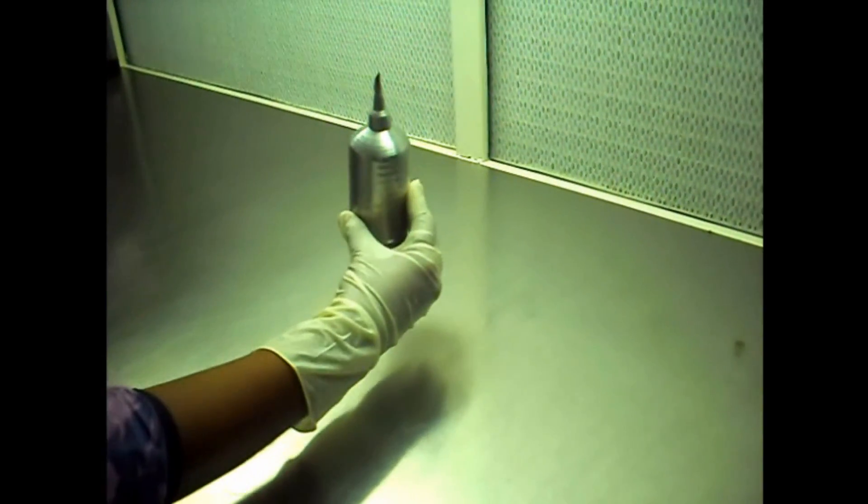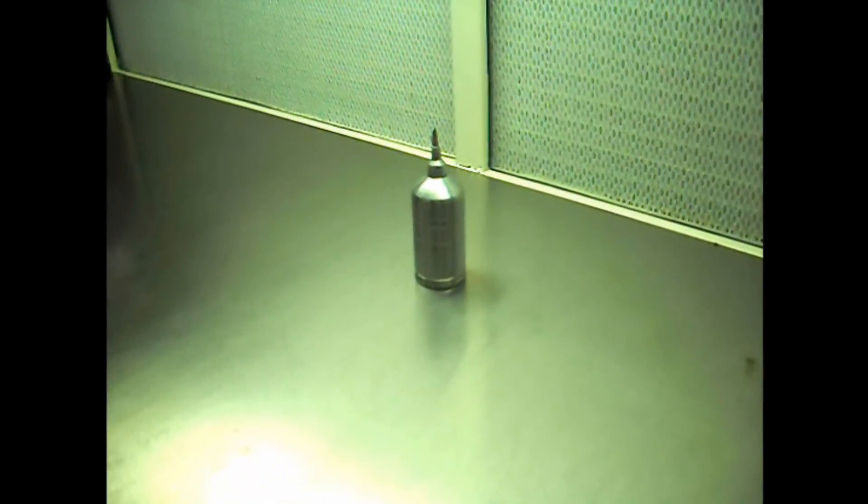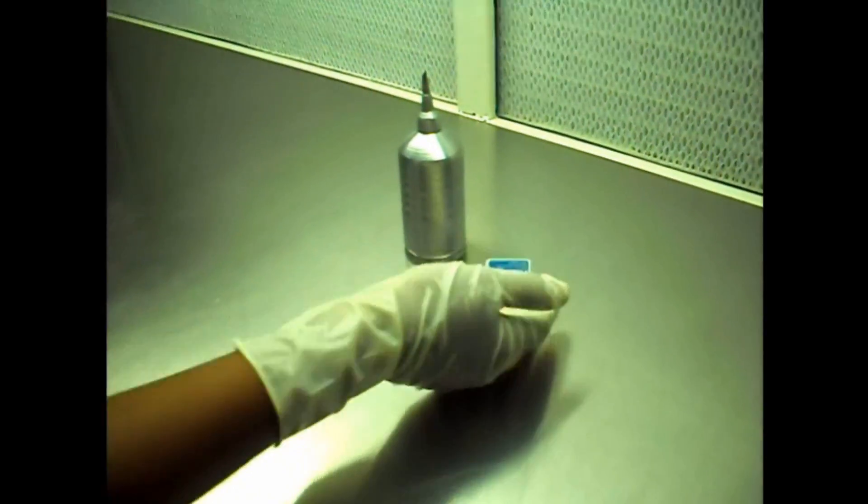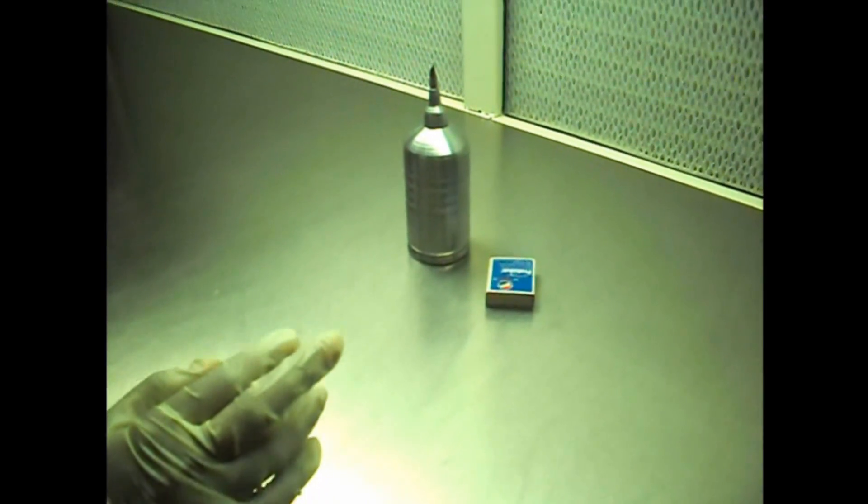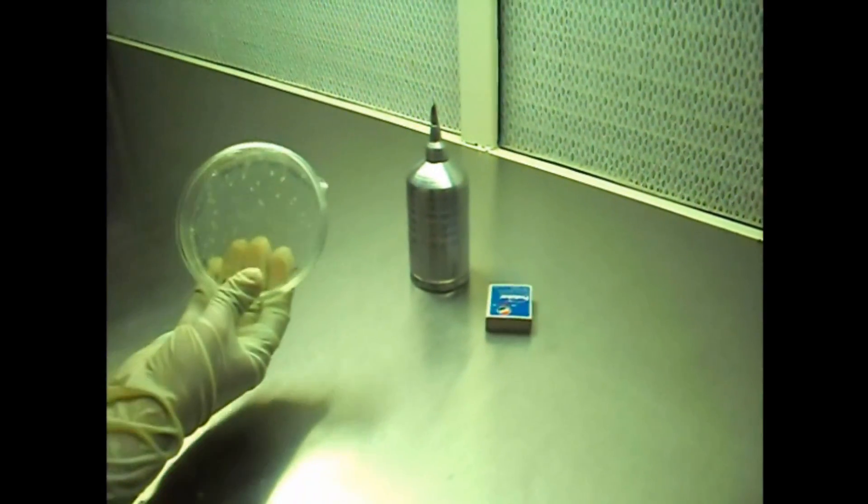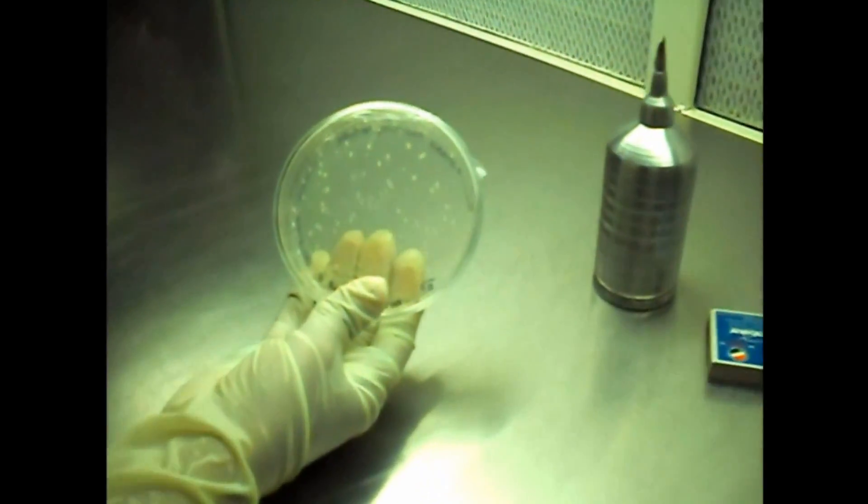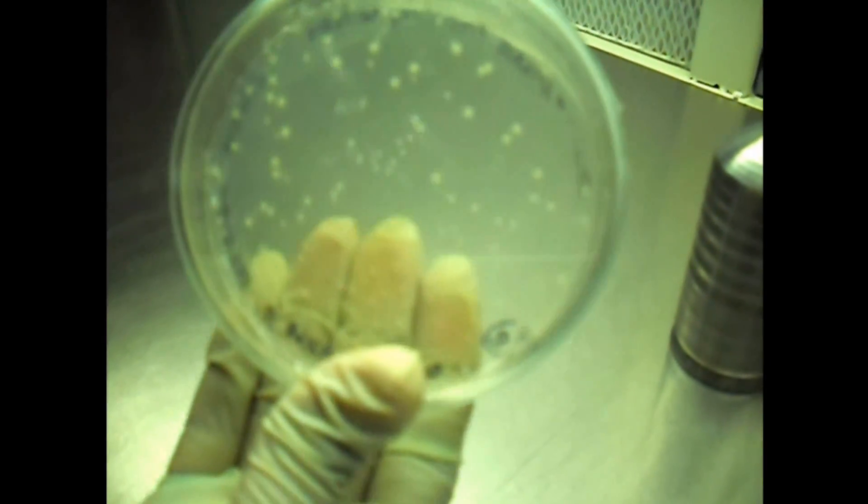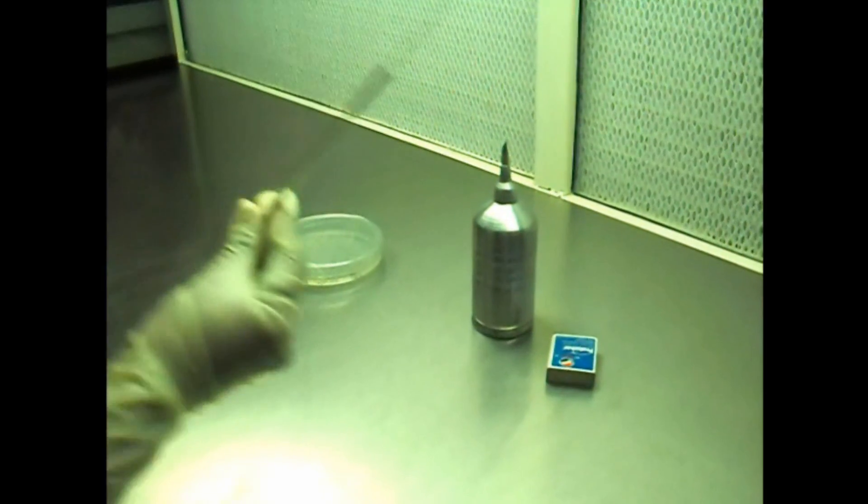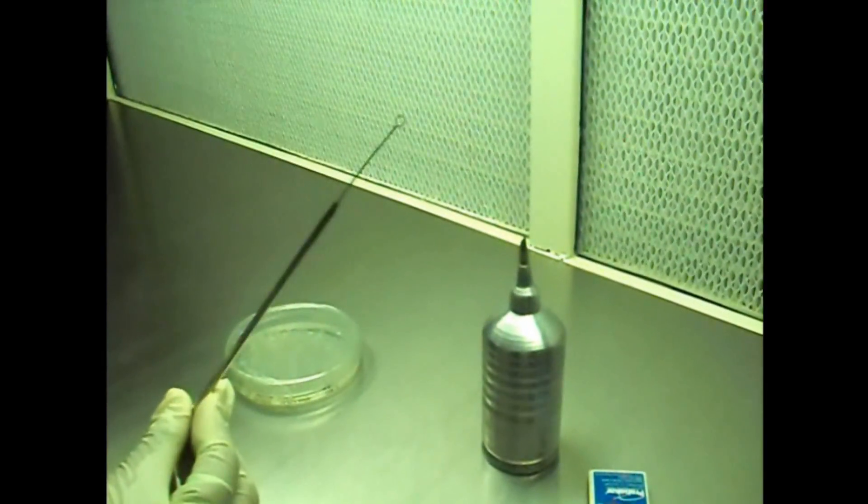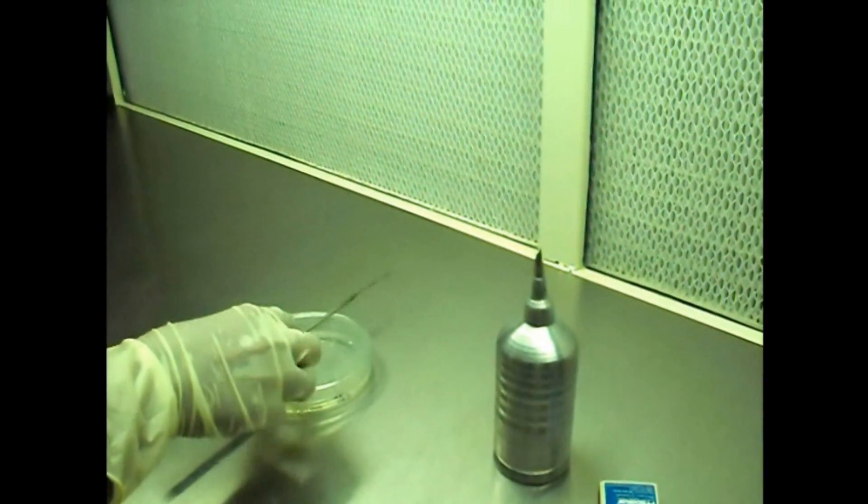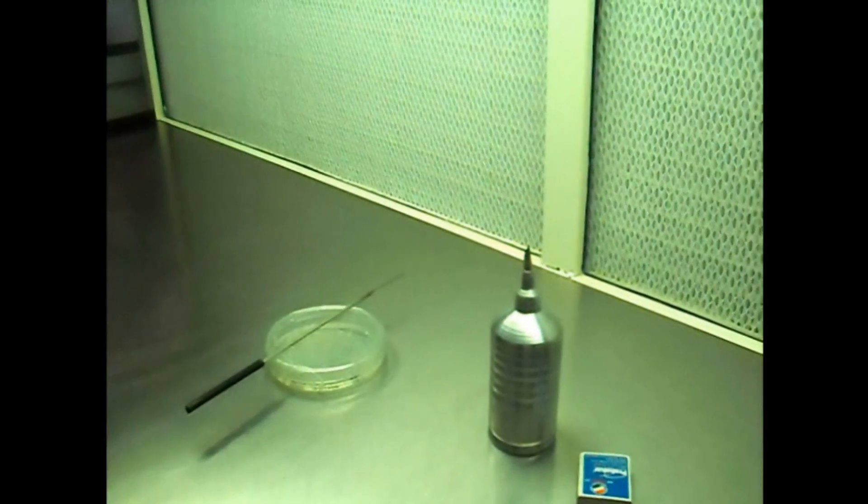The materials required are spirit lamp, matchbox, bacterial culture, inoculation loop, and dropper.